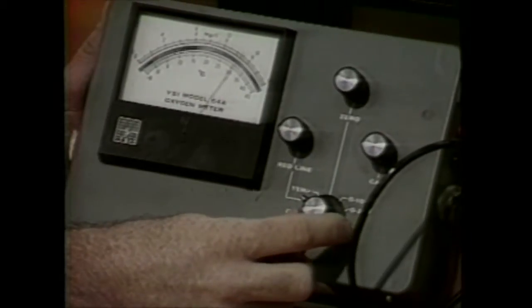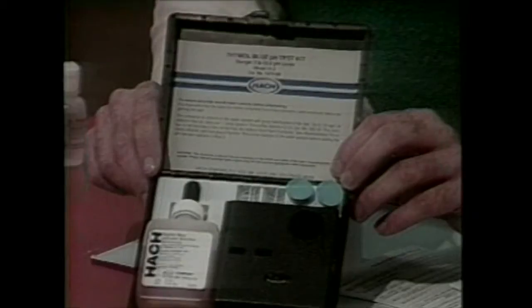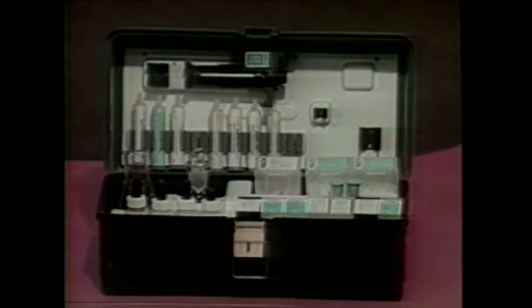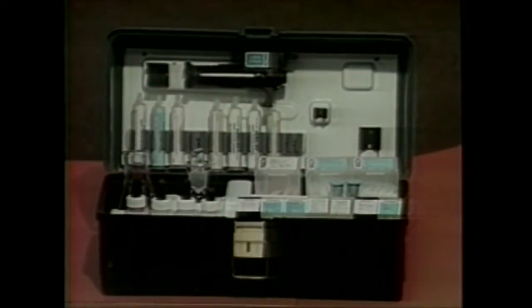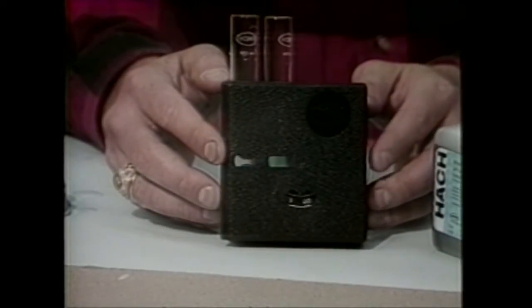Throughout this video, water testing equipment such as kits and meters will be shown. Testing examples will employ a specific kit or meter simply for convenience. The producers of this video series do not endorse any of the particular kits or meters. Keep in mind that other kits and meters are available and procedures may differ slightly from the examples shown in this video.